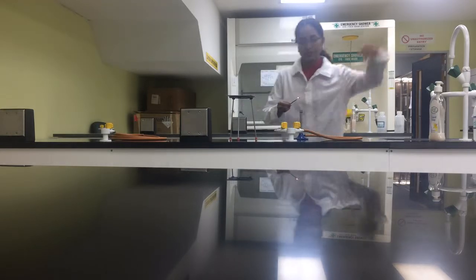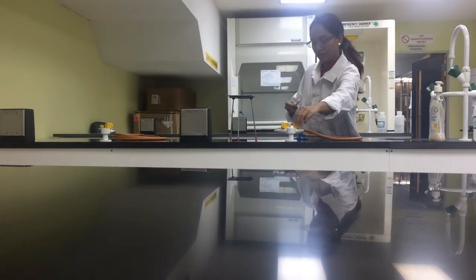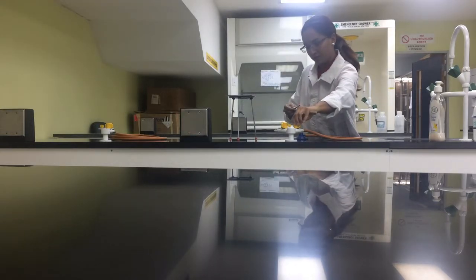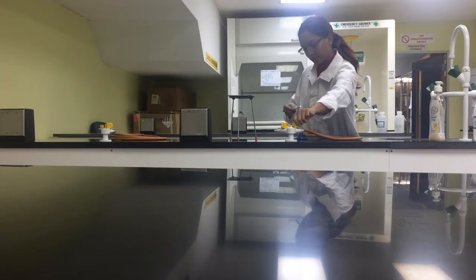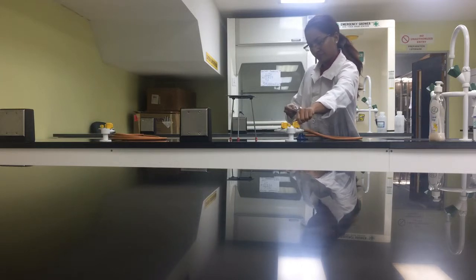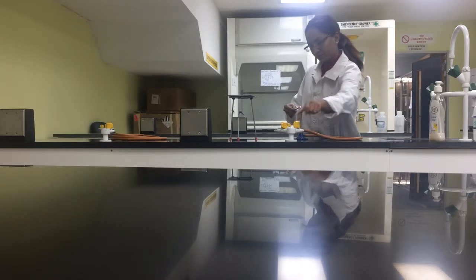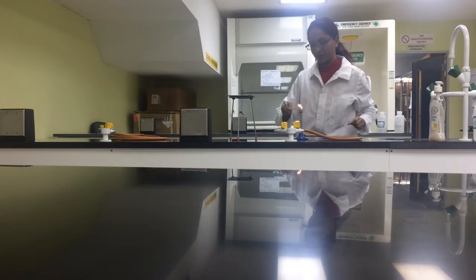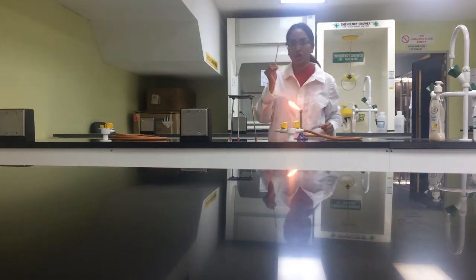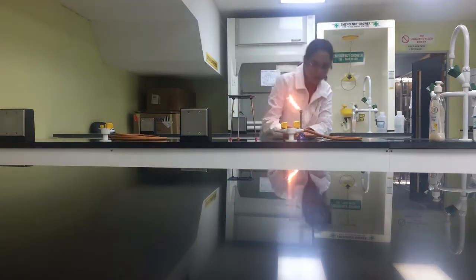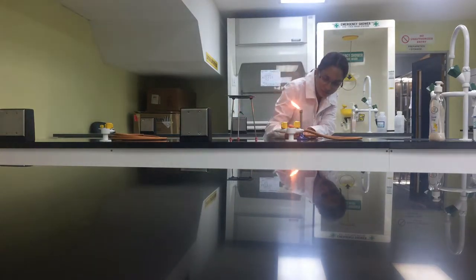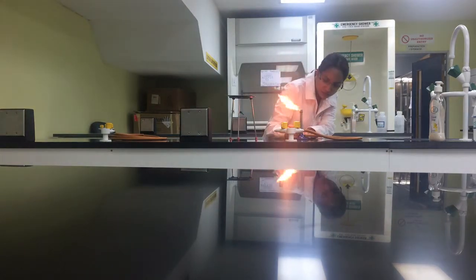Then you want to make sure you lift and then you turn. Then you hold the flame and then you turn it.